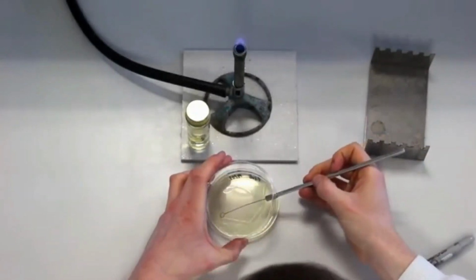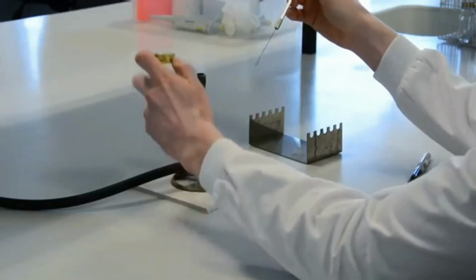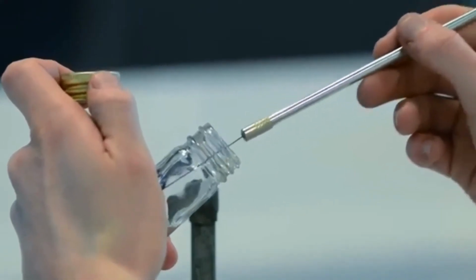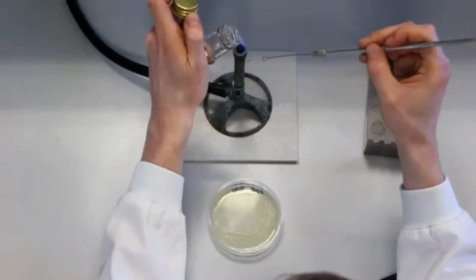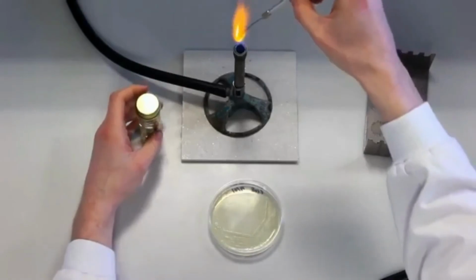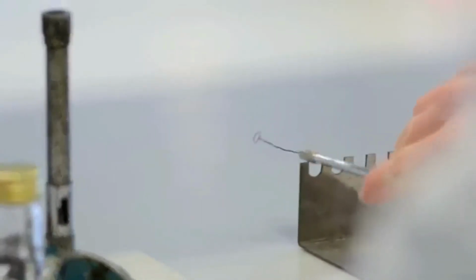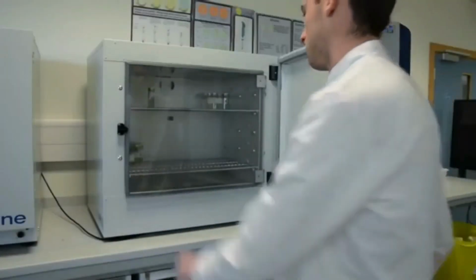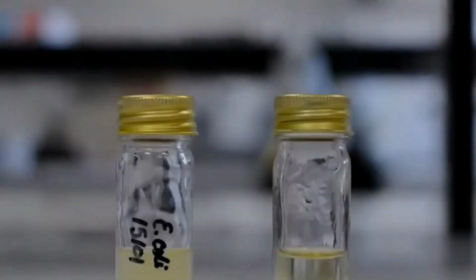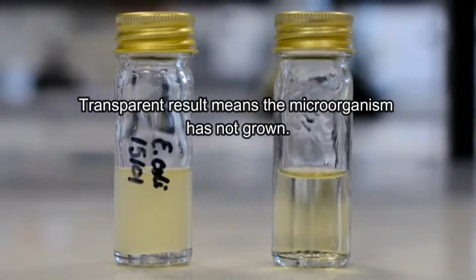Once open, the bottle neck is flamed. This flaming draws any aerosols in the bottle into the Bunsen burner flame. The bottle is slightly tilted and the inoculum on the loop is rubbed onto the inside of the glass bottle, so that when the bottle is upright, the inoculum is submerged. The bottleneck is then flamed once more and the lid is replaced. Finally, the loop is sterilised, so it is safe to leave on the bench. After appropriate incubation, a broth will appear cloudy or turbid. If a broth remains transparent, it means that the microorganism hasn't grown.